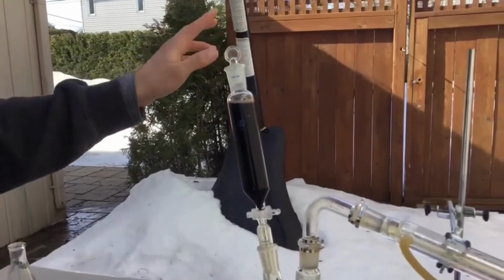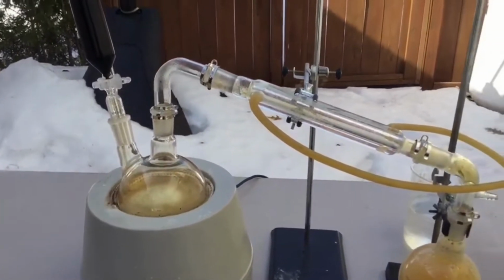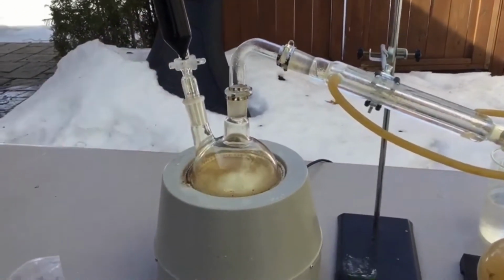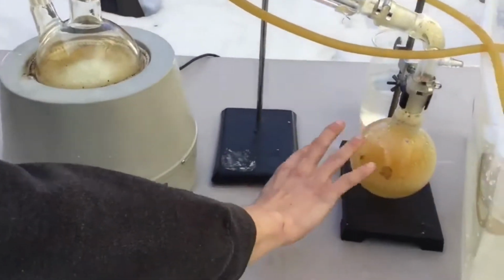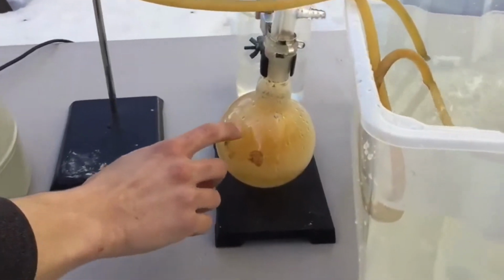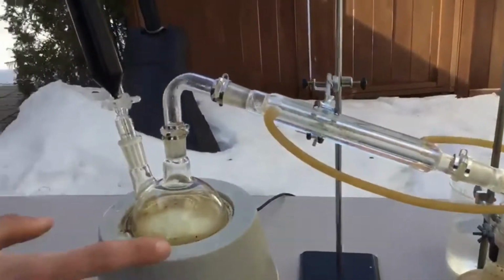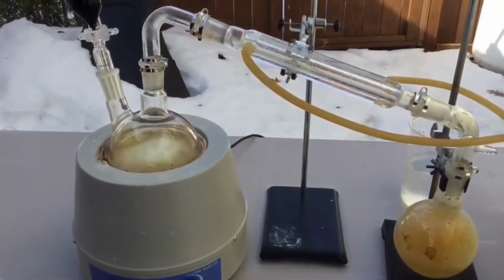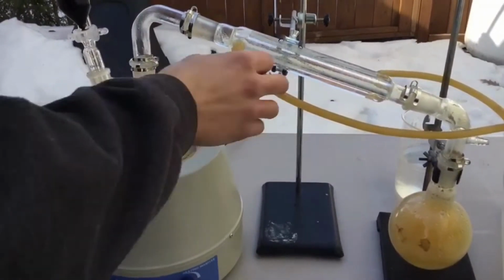Add the stopper here. And so now I'm going to let the reaction calm down, and I'm going to start adding sulfuric acid by the drop. It's already doing it, so that's why I'm not adding more. And as you can see in the receiving flask here, it's all orange and you can't see a thing. That's the nitrogen dioxide, a gas that is produced from the nitric acid. This is a loss, but it's really minor, honestly.